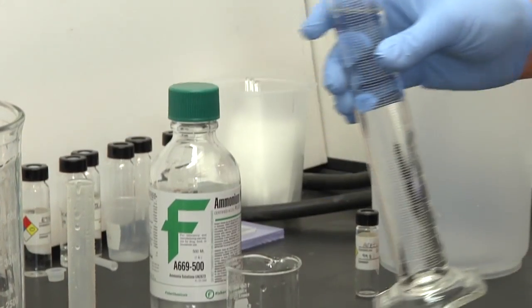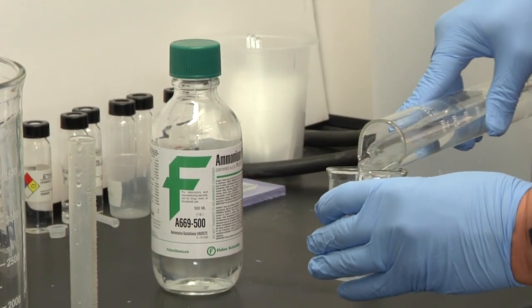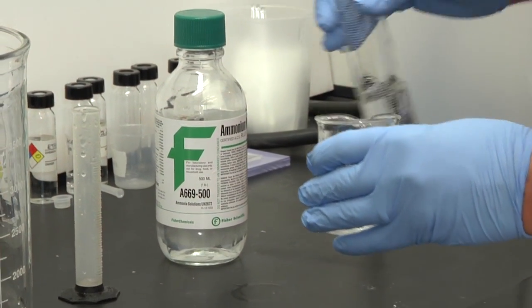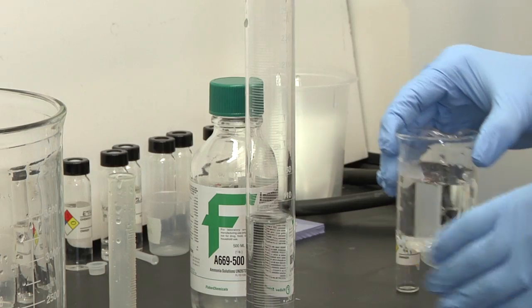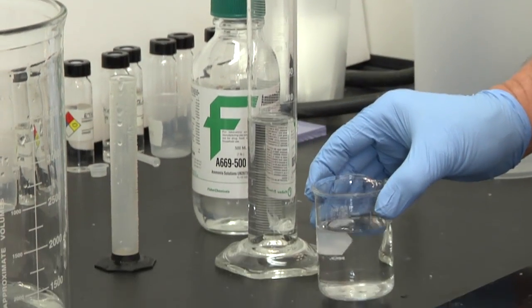We can now pour this 10% ammonium hydroxide solution into a beaker or some other container. And this is much safer and certainly doesn't smell as bad. And we can use it in the general studio environment.